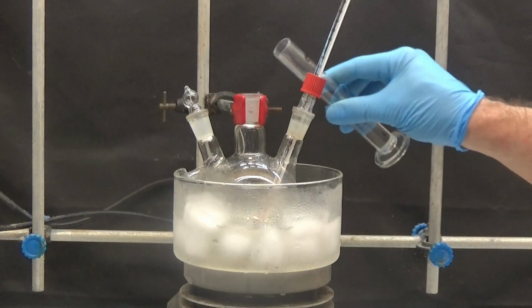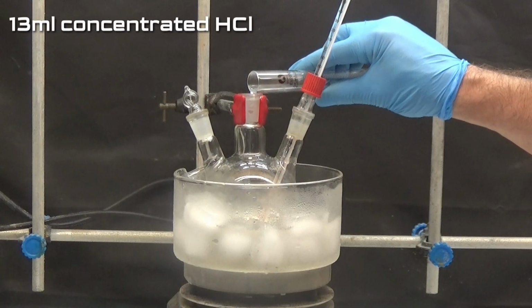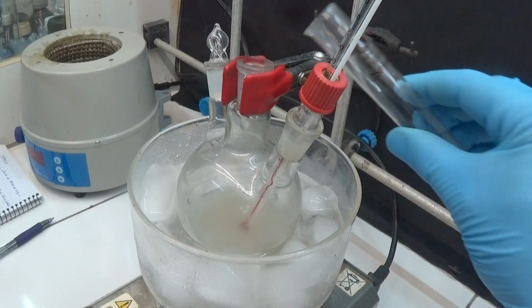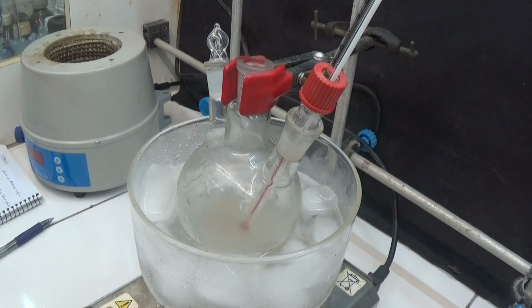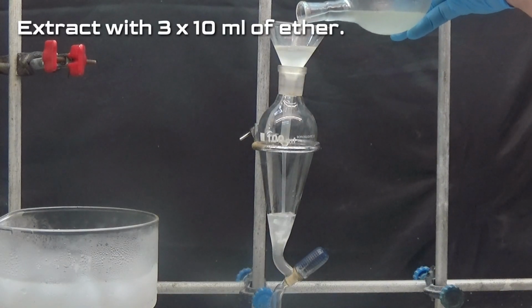To separate the dichloroacetic acid, add 13 ml of concentrated hydrochloric acid at a temperature between 0 and 5 degrees. Extract the obtained acid with 3 portions of 10 ml of ether.